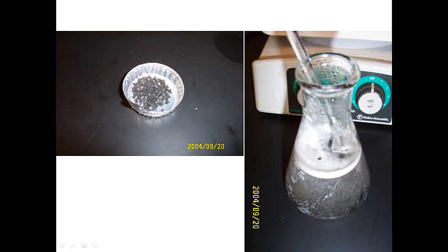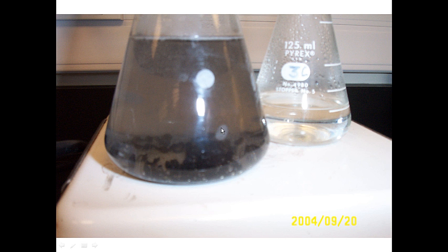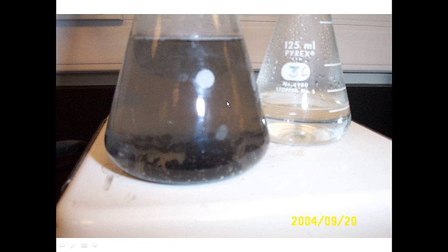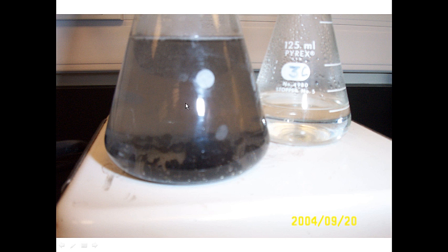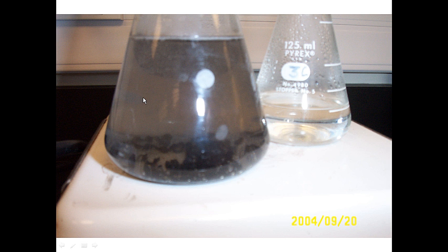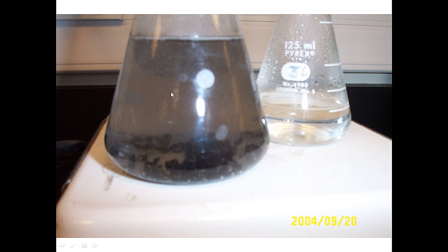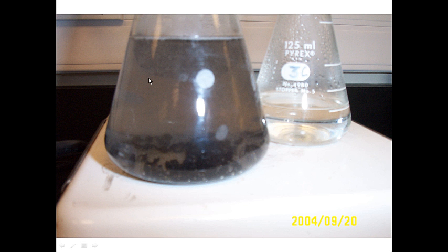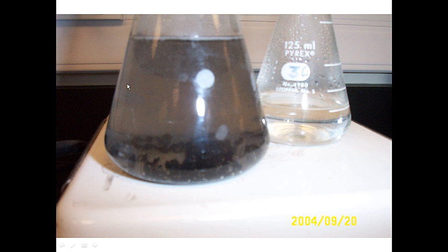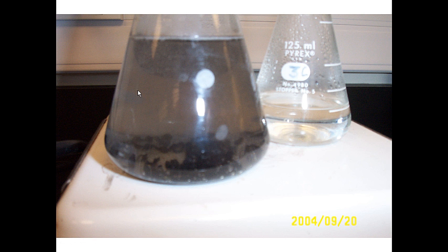Once the solution is close to fully dissolved, add the decolorizing charcoal in the amount specified in the handout. Remove the Erlenmeyer flask from the hot plate, pour in the decolorizing charcoal, then return it to the hot plate. The solution will become cloudy as some acetanilide precipitates, but as you reheat it will become clear. We want a nice clear solution, which tells us all the acetanilide has dissolved.